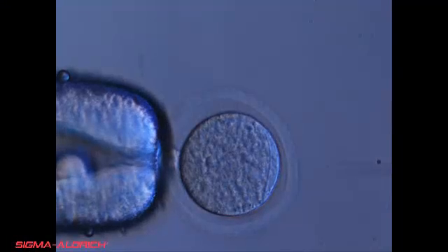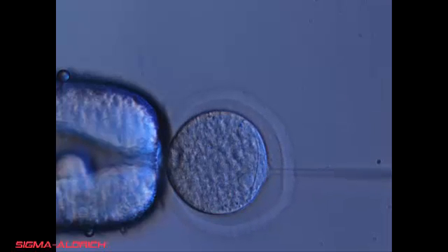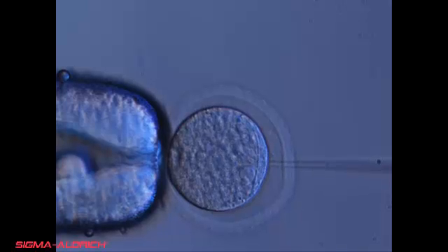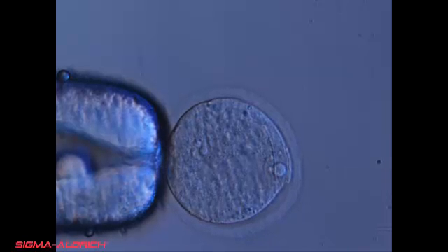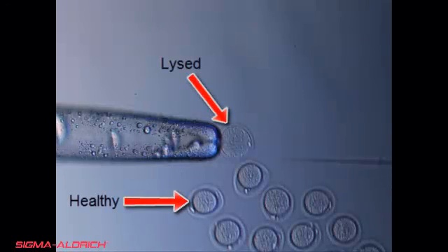For illustration purposes, the microinjectionist purposely pierces the zona and vitelline membrane and presses the purge function of the femtojet, which expels an enormous amount of injection solution out of the needle. DNA in the cytoplasm alone can cause apoptosis. This large amount of solution injected into the embryo causes the pronucleus to move out of the cytoplasm slightly, and cell death will occur. The embryo lysed by purging is compared to previously injected embryos that are healthy. This is to show a lysed, dying embryo compared to a non-lysed, living embryo.